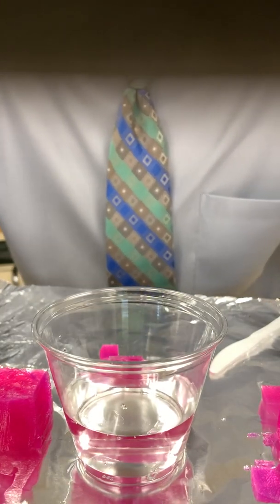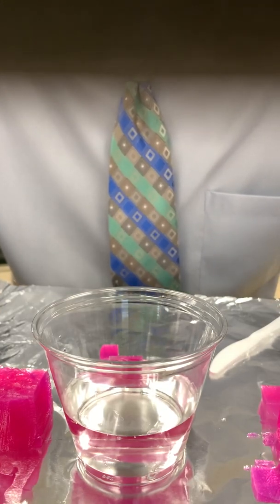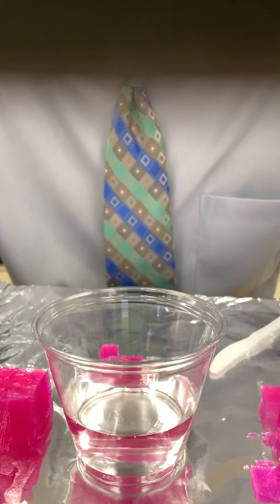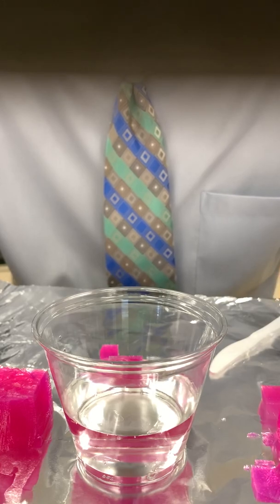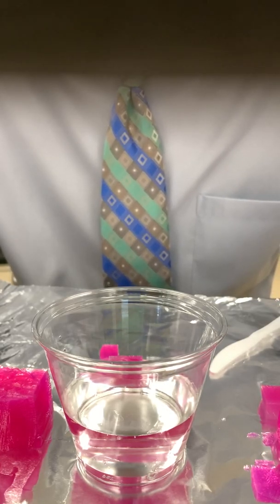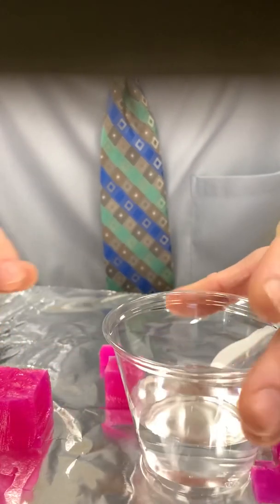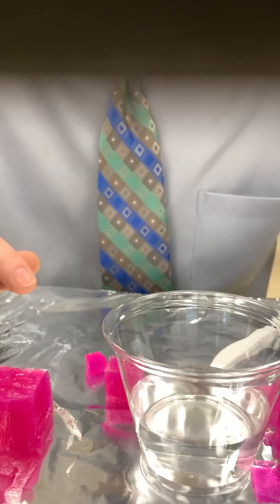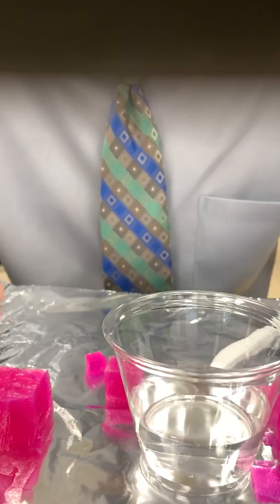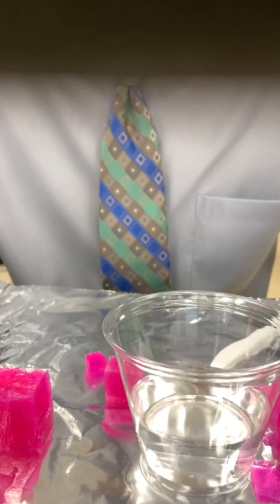Ideally, you would put the large one in first so that gives you time to figure out how you're going to measure. If you put all three cubes in at the same time, that's okay as long as they all come out at the same time. If it takes you too long to measure the large cube, by the time you get to the small one, diffusion is still occurring while you're working with the others. You might end up with results that are slightly skewed.